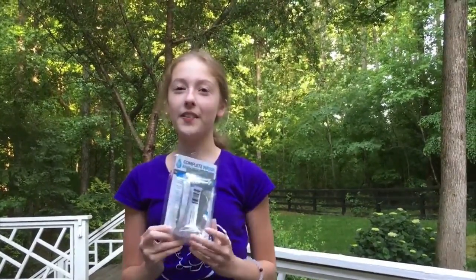So I have some tap water from my house here, and I'm going to see what's in it. You can order one of these kits off Amazon for $25 — it's called the drinking water test kit. I'll be right back; I'm going to open it and see what's in my water.